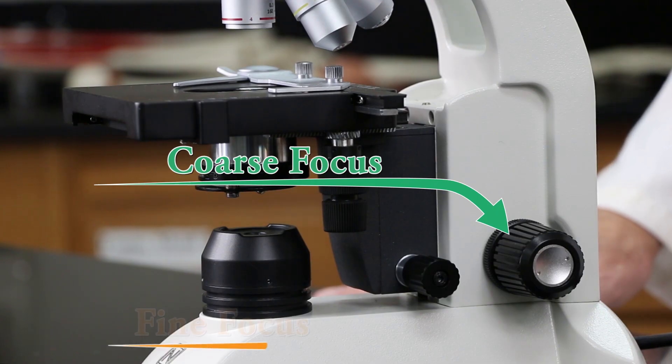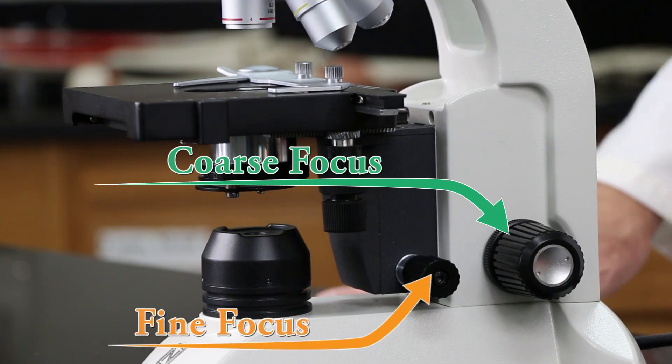Then, when you move it to subsequent lenses, the low power and the high power lenses, only use the fine focus.